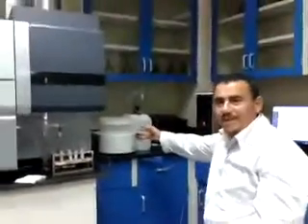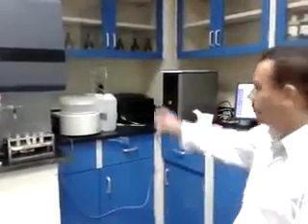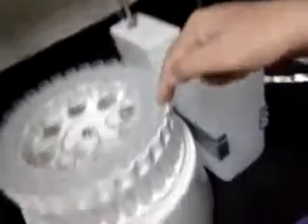You can ask me why we use manual — you have an auto-sampler here. You asked me yesterday why I don't use the auto-sampler. The auto-sampler was brought yesterday, but the technician from the company didn't come to fix or install it. So it takes a lot of time to take the sample manually. But if we have the auto-sampler working, this here will hold 15 to 50 samples, and it will absorb, wash, and transfer to the next sample until finished.